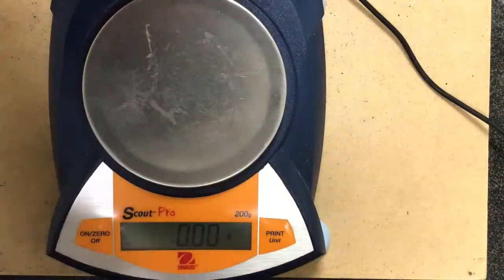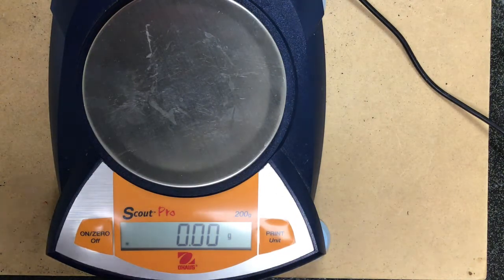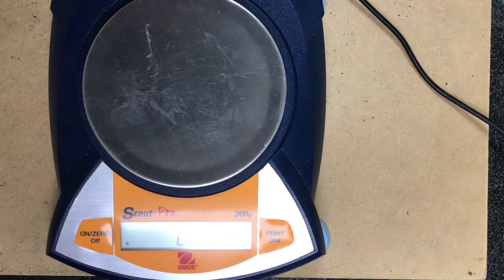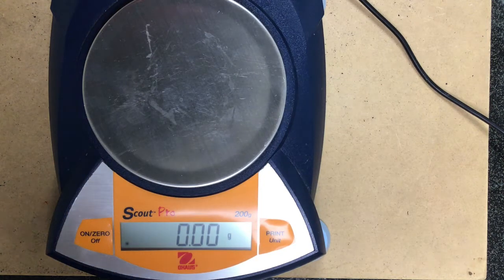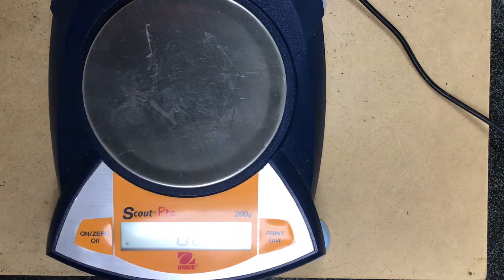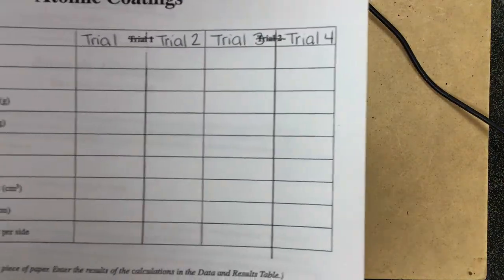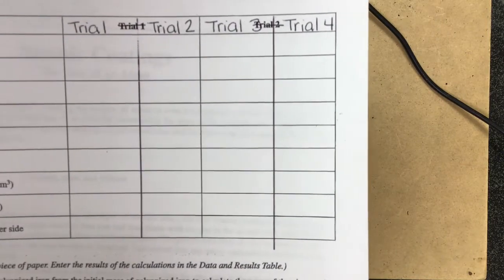All right, so in this lab, it's going to be really important that all of these measurements are made accurately. Normally, we only are able to do 1 or 2 trials per group, simply because the 6 molar hydrochloric acid isn't exactly cheap. And this galvanized iron, it's not expensive, but it's just not something that we have in mass quantities. However, because no one else is in the room with me and I'm kind of bored, we're actually going to do 4 trials. I want us to make sure that we have really good data.